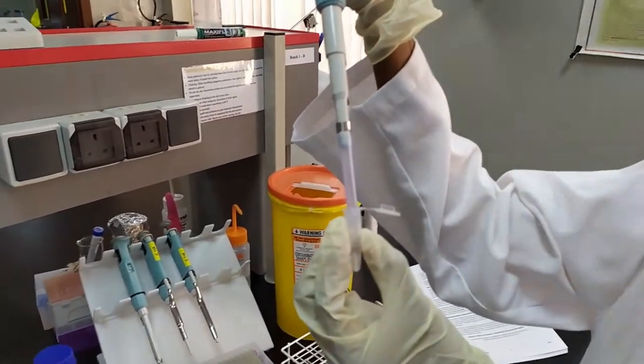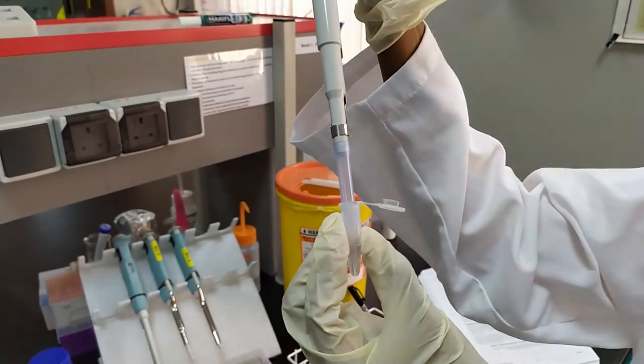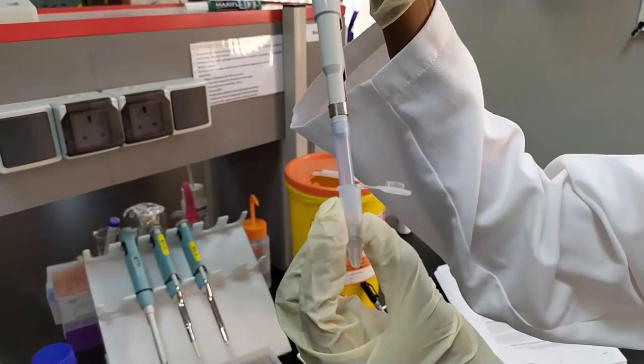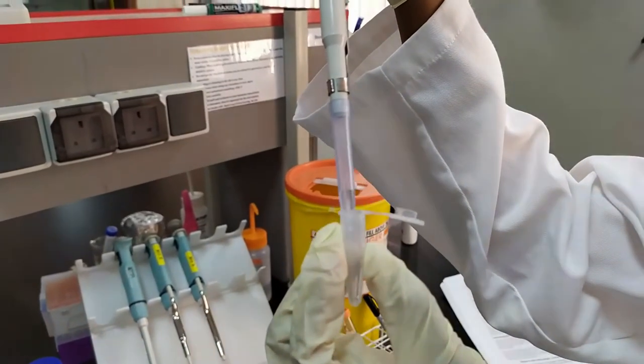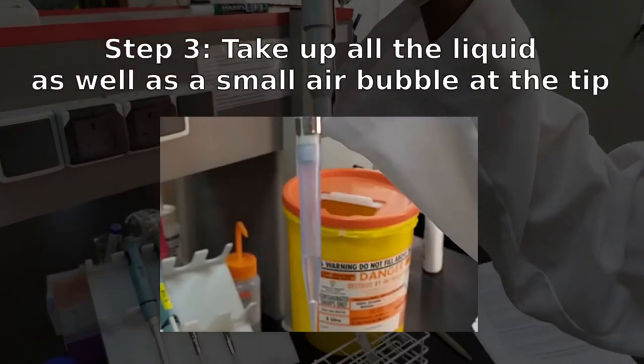Once you have that, as you can see here, Laconia is going to draw up all of the liquid from inside the tube. Now what we're trying to do is actually get all the liquid plus a little bit of air in the bottom of that tip.